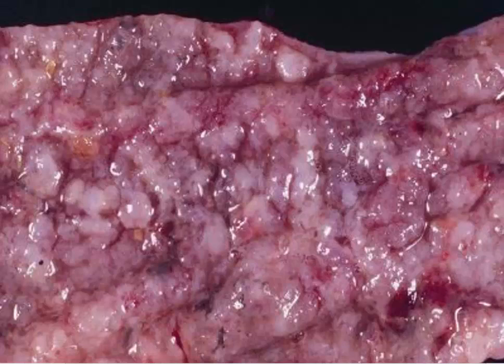It's very red, looks somewhat necrotic, and we're going to play the gamesmanship bit a little here, because when I look at something like this, one of the first things that pops into my head is, could this be a uterus? Could this be cystic endometrial hyperplasia? But then, how would I come up with 3 causes? When someone asks you for that many things on a test, I think that they're probably going for a toxic principle or perhaps an infectious disease. In this particular case, we're looking for an infectious disease.